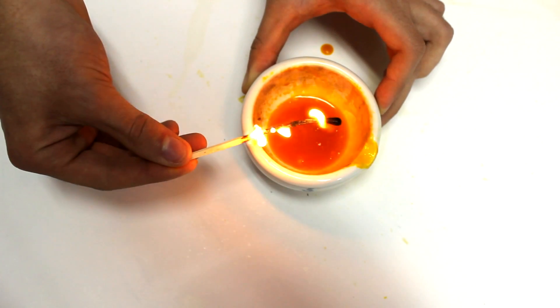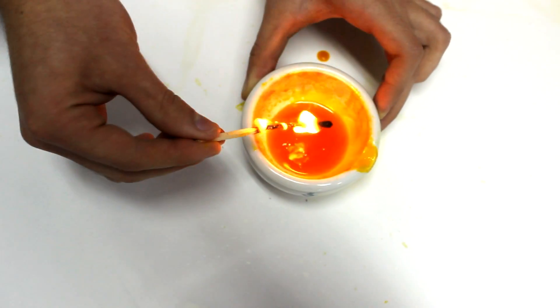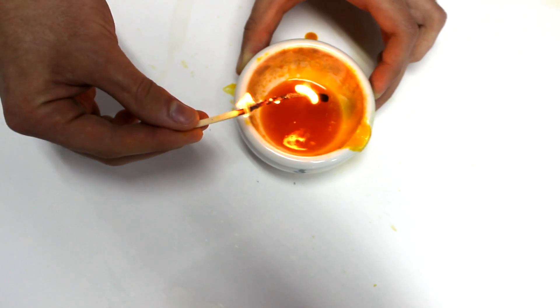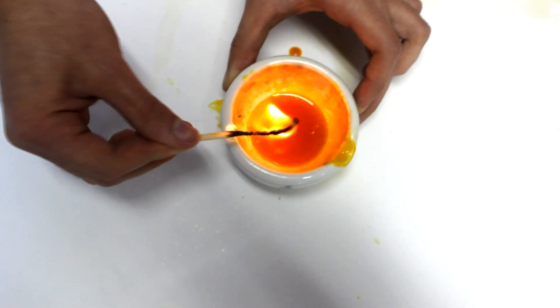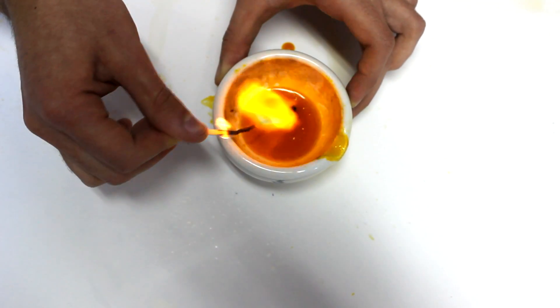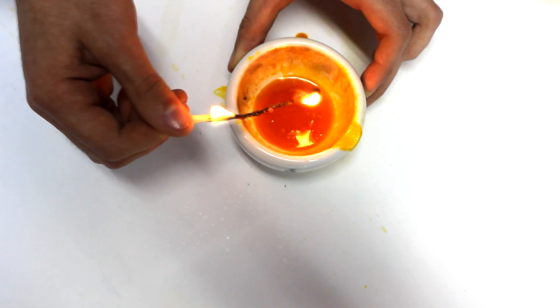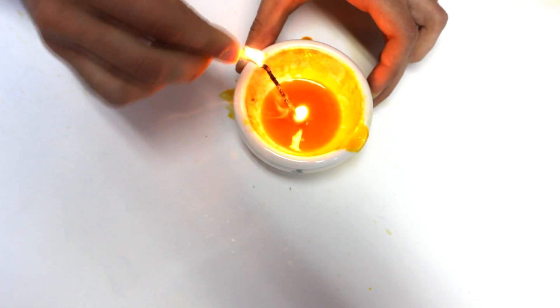Finally, we moved to the testing phase. For that, we lit a match and moved it over the biodiesel. We realized that the flame became stronger every time it touched our compounds. Therefore, we concluded it was combustible. All in all, we had created biodiesel.